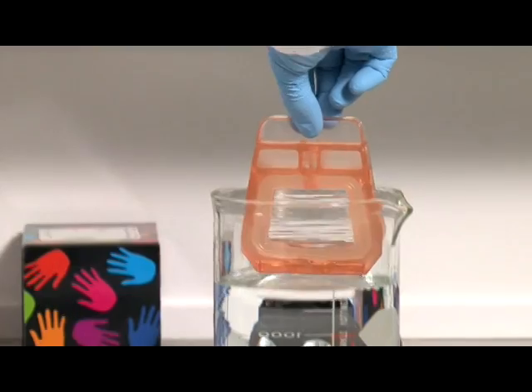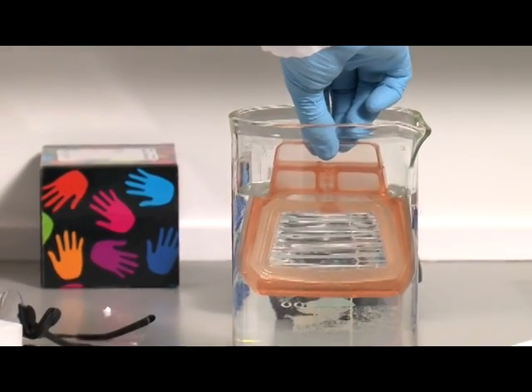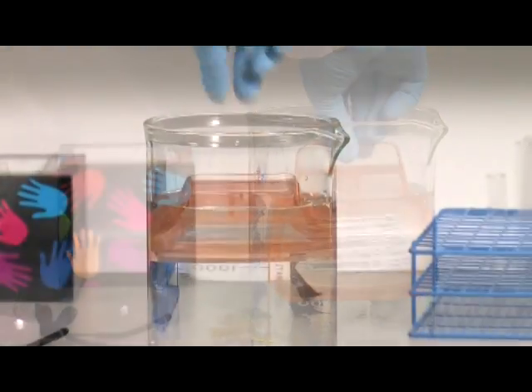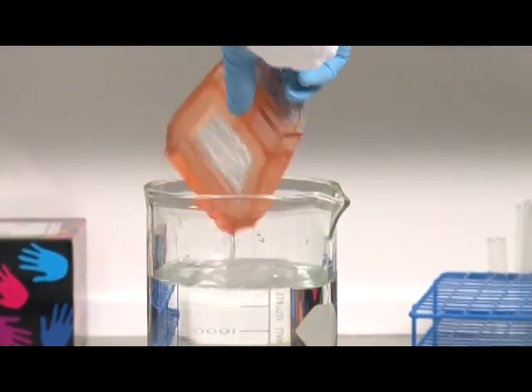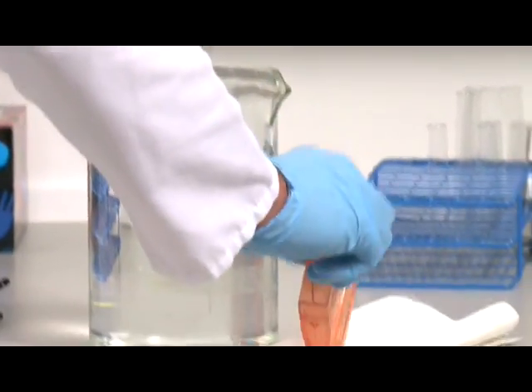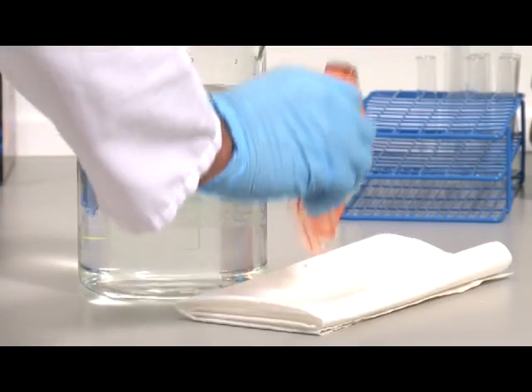First, hydrate the membrane by soaking in dialysis buffer or water for two minutes. Lightly tapping the unit on bench paper will remove and prevent excess liquid from entering the cassette and diluting your sample.